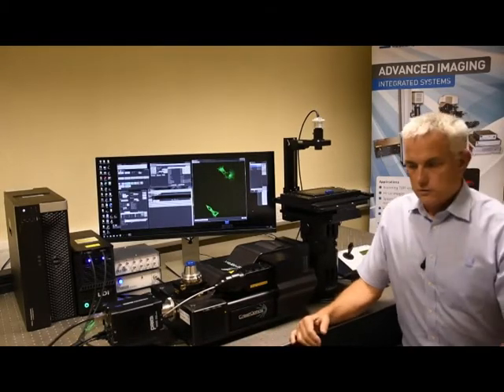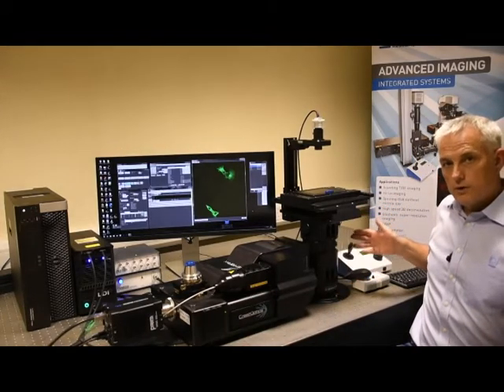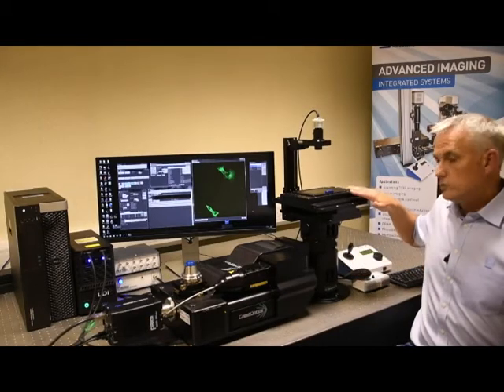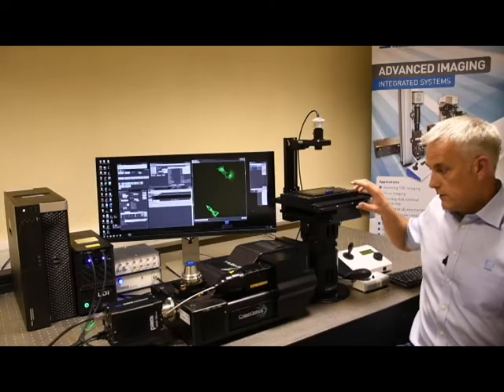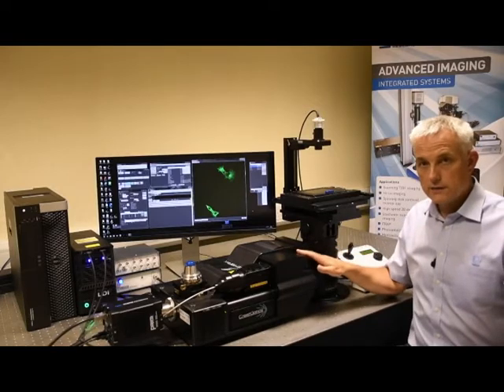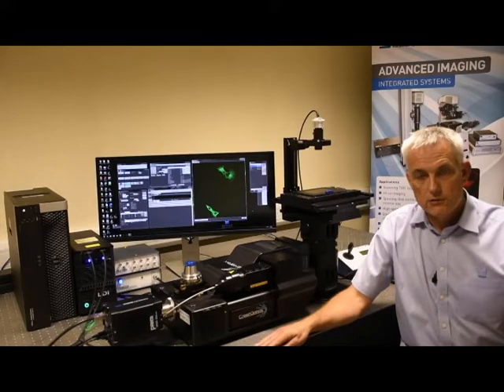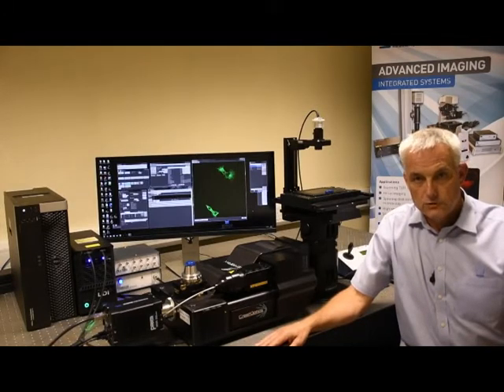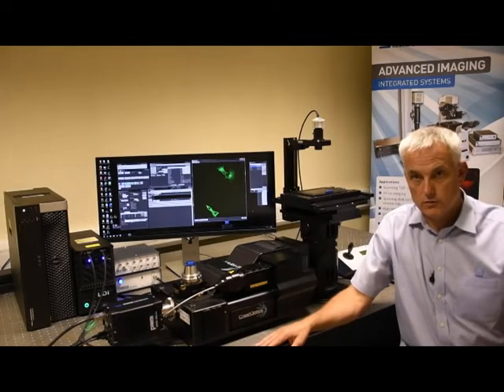In our earlier presentation, you will have seen the open frame and been introduced to the different components of that. So here we have a base configuration on which we've mounted an automated XY stage with the fast piezo Z, and on the side of the unit we have the Crest X-Lite spinning disk confocal. We construct our acquisition systems around a variety of software acquisition platforms, but this afternoon we are going to show you the system integrated using the open source platform Micro-Manager.